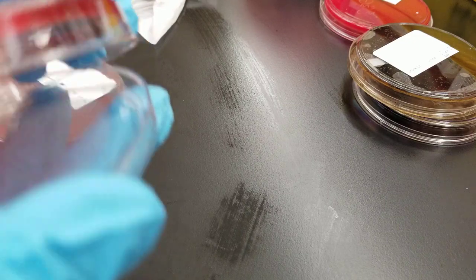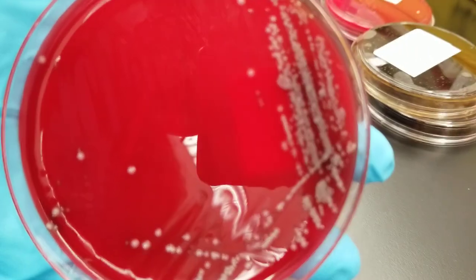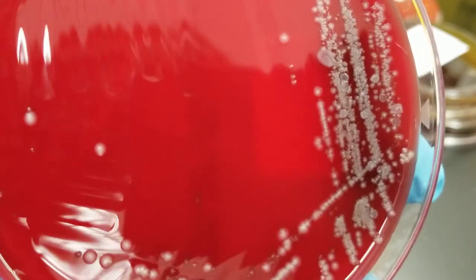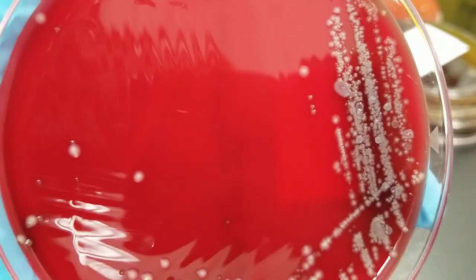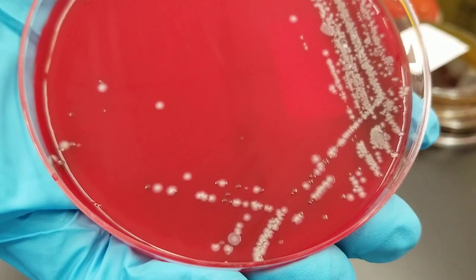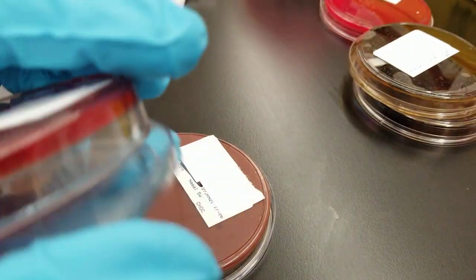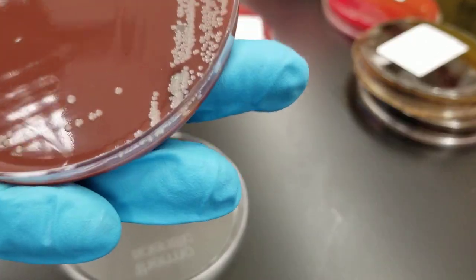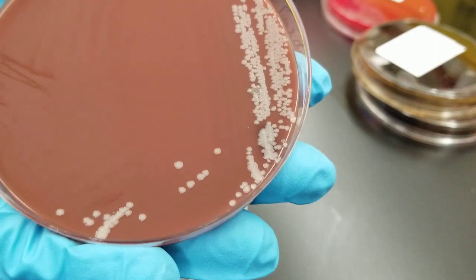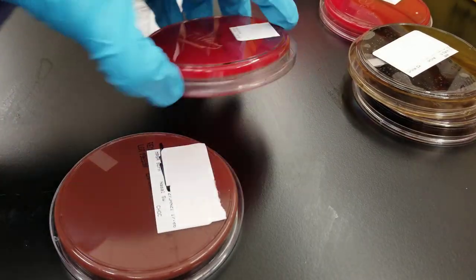We also have a nasal swab on blood agar plate and chocolate agar plate. Again, this looks like staph. There are a couple of organisms — the really gray ones look like staph, the whiter ones could be something else. There might be three different organisms because you have the white ones, smaller darker ones, and the gray ones. They thought the same thing and did an MRSA screen — methicillin-resistant Staphylococcus aureus. I don't have that result either. This is the growth on chocolate agar; many organisms that grow on blood agar will grow on chocolate as well.